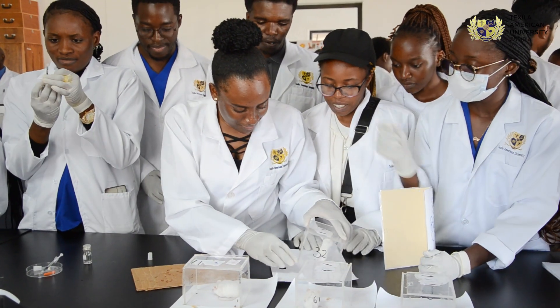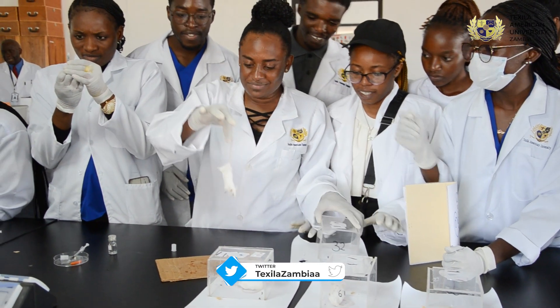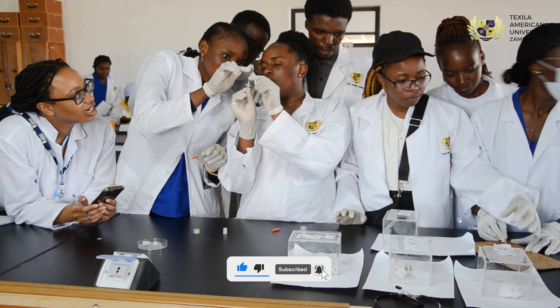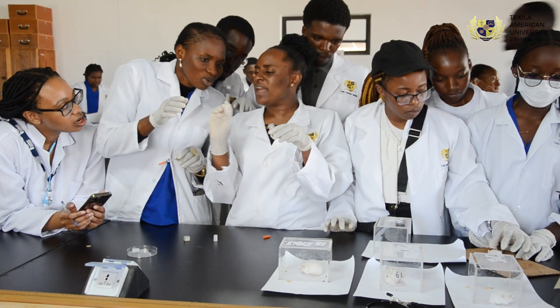So today, we are looking at individual variation. They are administering the sodium pentobarbital in the mice to just see the individual variation in terms of weight. Because normally, depending on the weight of an individual, the outcome of therapeutic effects of drugs may differ. So today, they were just demonstrating that.